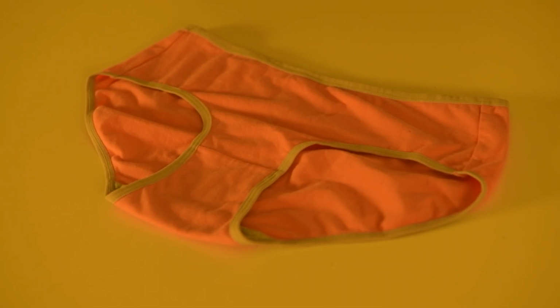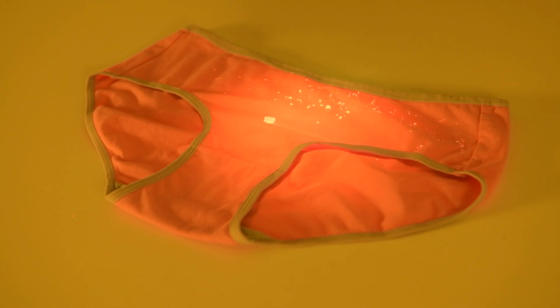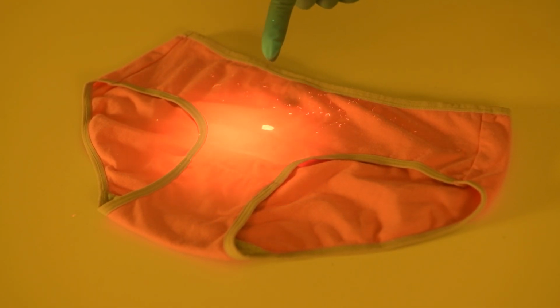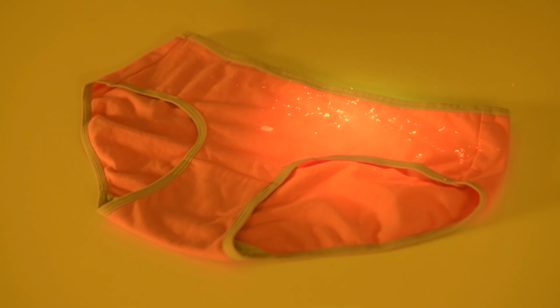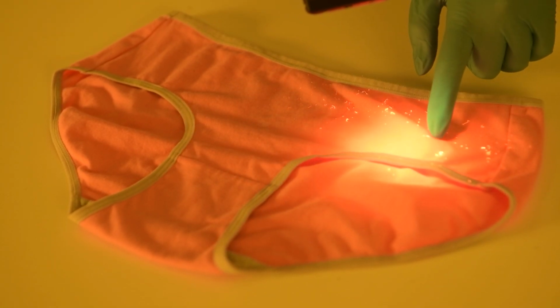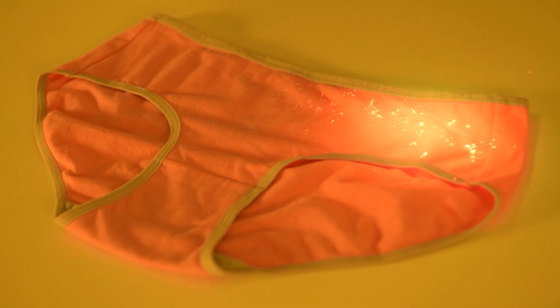As I turn on the blue 82 Pro, what we can start to see is, yes, this main area of staining in the middle just here. But what's important to note is that it's not just body fluids that we may be looking for when we're using fluorescence. Yes, most body fluids, as you can see here and also to this smaller area of saliva staining over here, do emit some sort of fluorescence. Some are more fluorescent than others, but fluorescence can be a fantastic tool to search for body fluids.